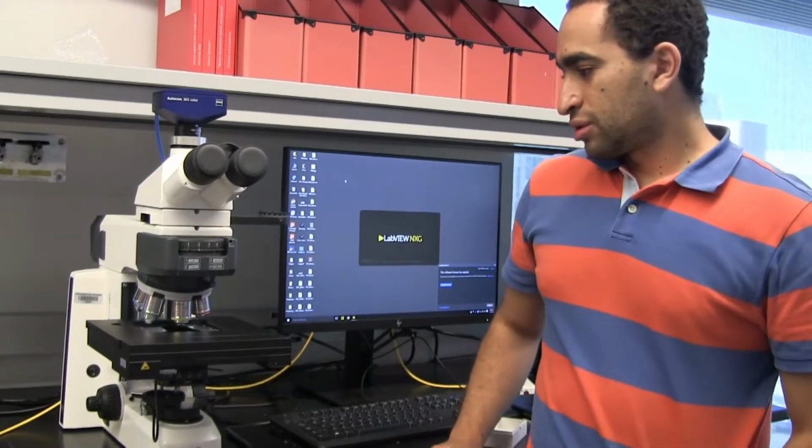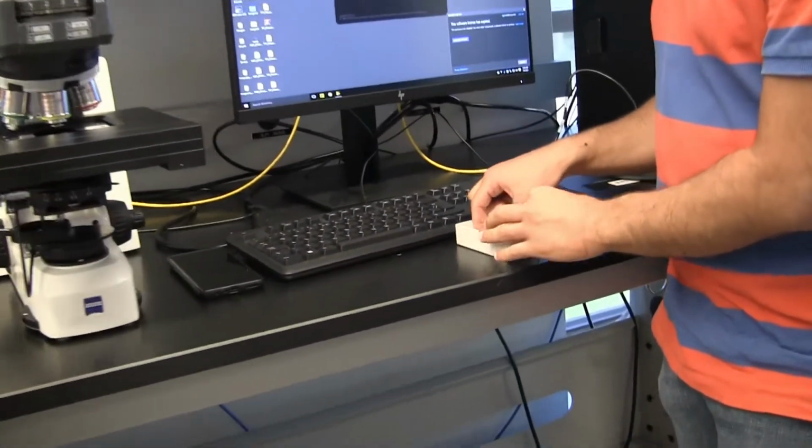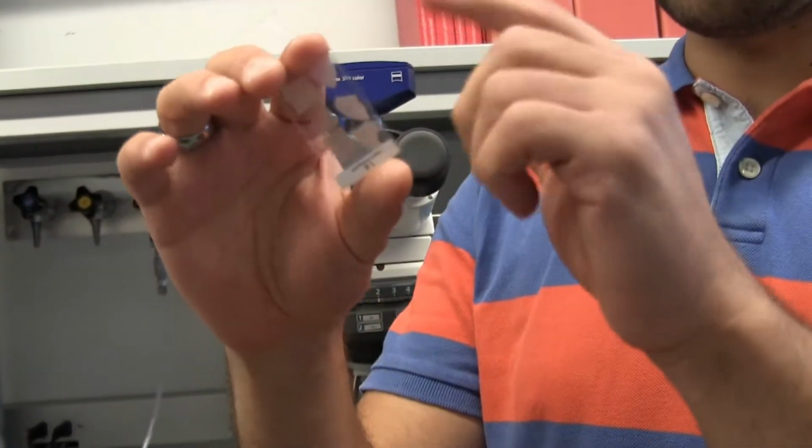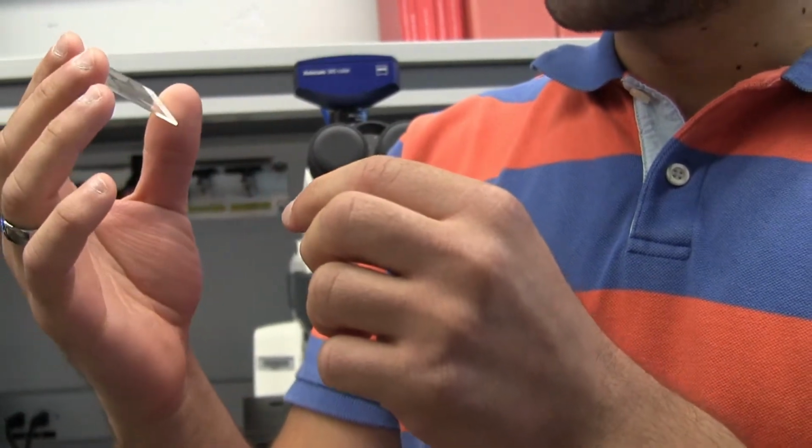So we have an optical microscope from Zeiss, and the optical microscope in general we can use for microfluidics imaging and for thin section imaging. In this video we'll just talk about the thin section imaging. For microfluidics applications there are other people who are more familiar with it. So for thin section, as you probably know, we cut a very thin piece of rock and we just put it between two glass slides, and then we try to image this with the optical microscope.